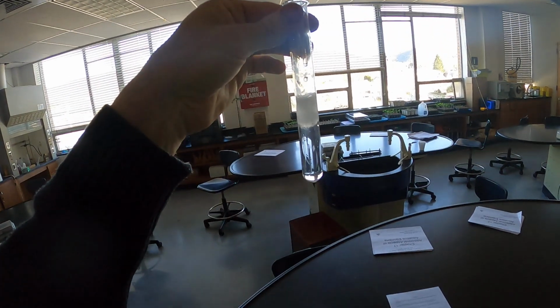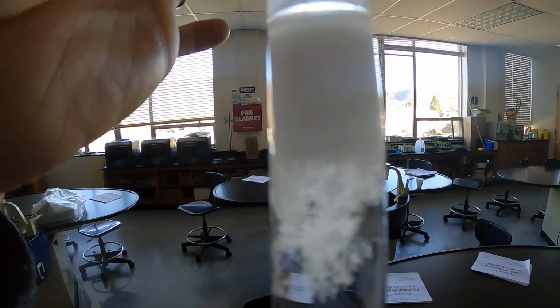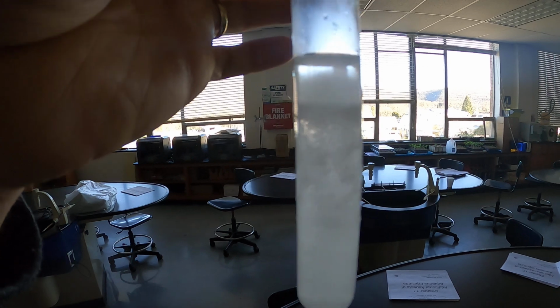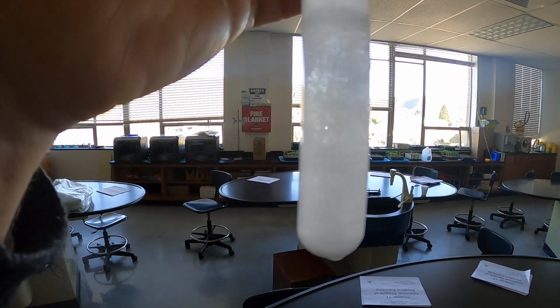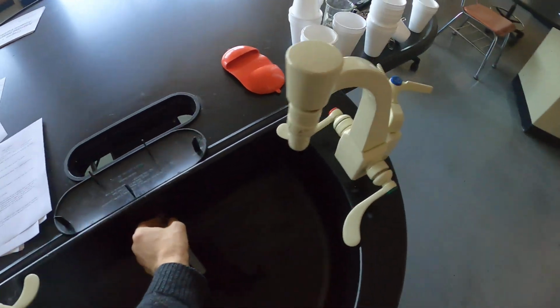What you see is the tremendous precipitation of sodium chloride, which is a very soluble compound, but it has a limit. And considering that saturated sodium chloride solution already is so packed with Cl- as is, the Cl- has no room left in that solution, so it precipitates out that NaCl, and that is my demonstration on common ion effect there.